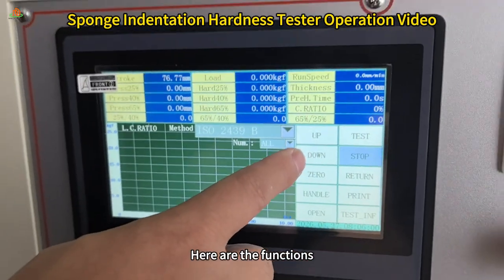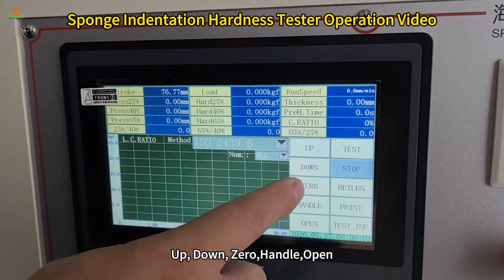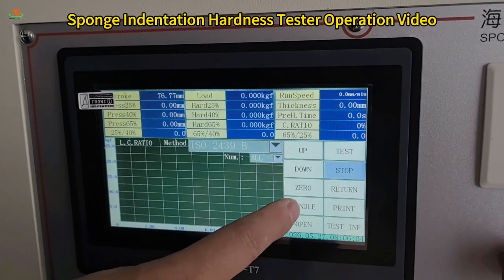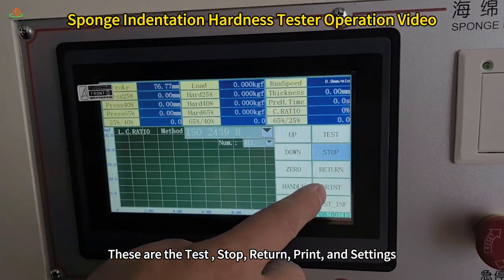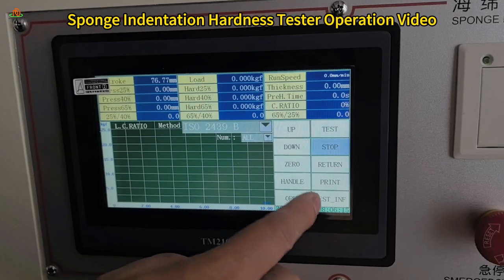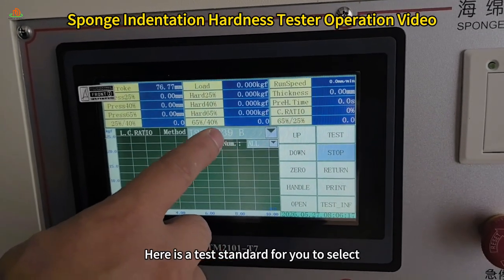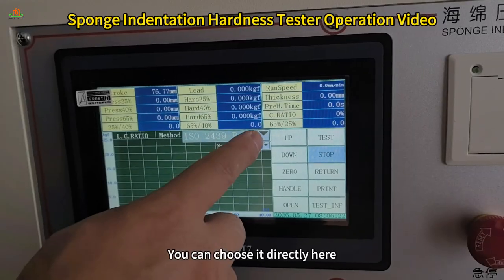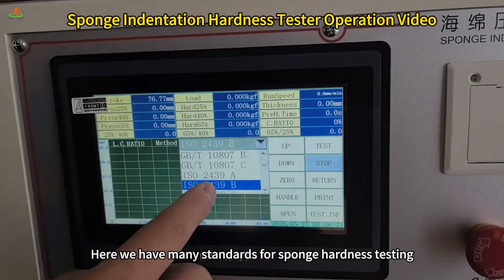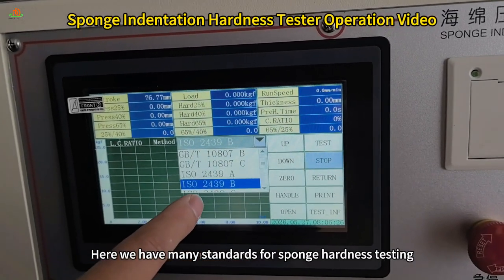Here are the functions: up, down, 0, handle, open. These are the test, stop, return, print, and settings. Here is a test standard for you to select. You can choose it directly here. Here we have many standards for sponge hardness testing.